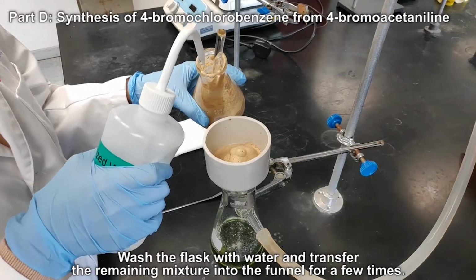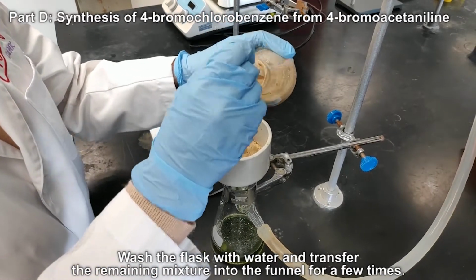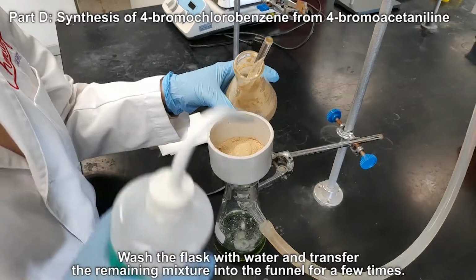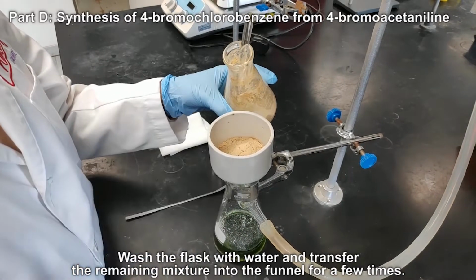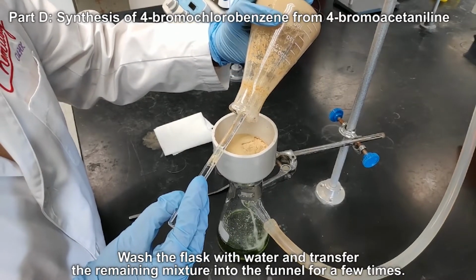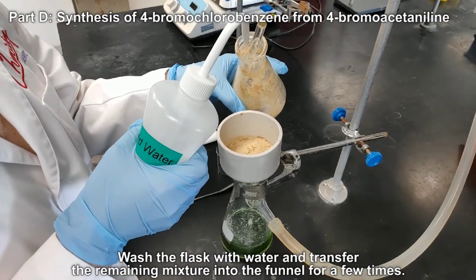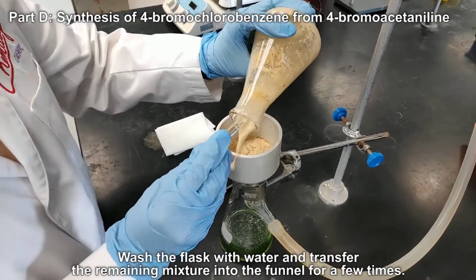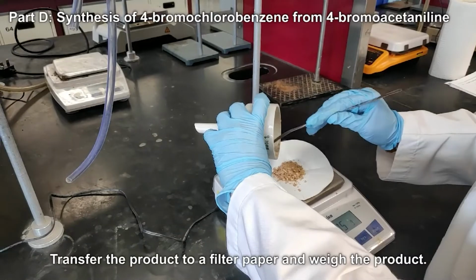Wash the flask with water and transfer the remaining mixture into the funnel a few times. Transfer the product to a filter paper and weigh the product.